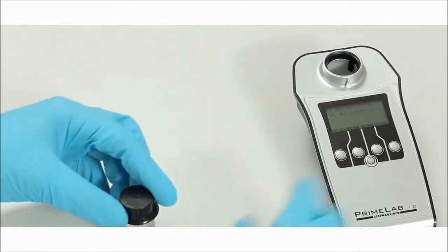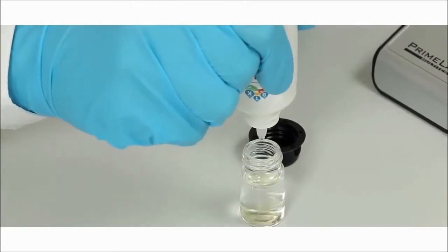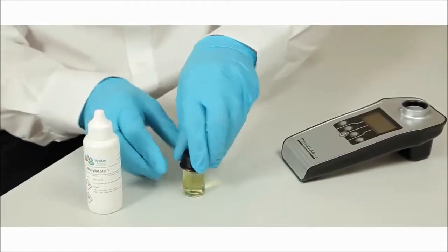Remove the cell and open the lid. Add 10 drops PL molybdate 1. Close the lid and shake well.